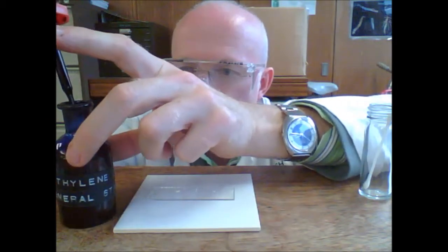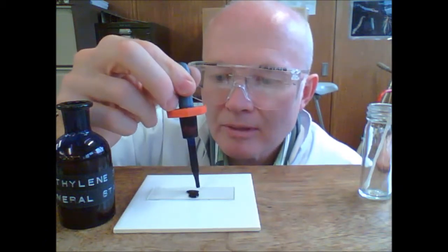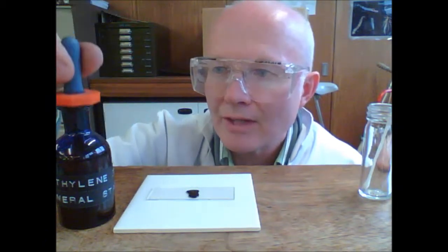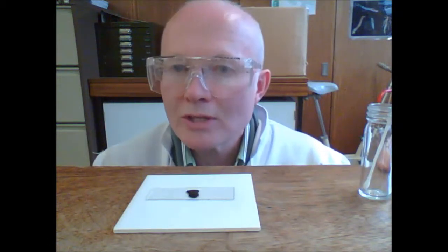Here we are. Okay, a couple of drops of methylene blue on the area you're trying to stain. You need to leave the stain on there for two to three minutes.